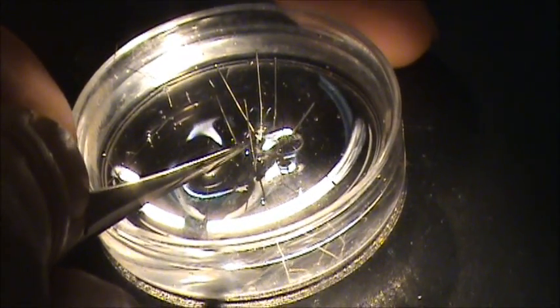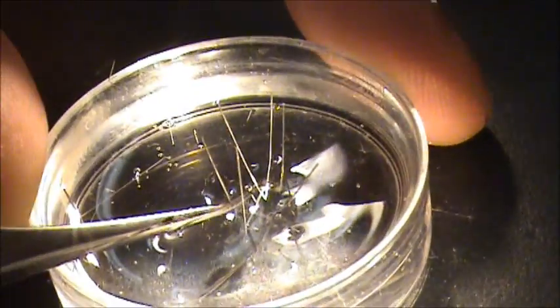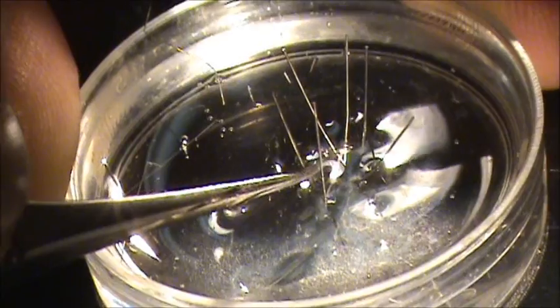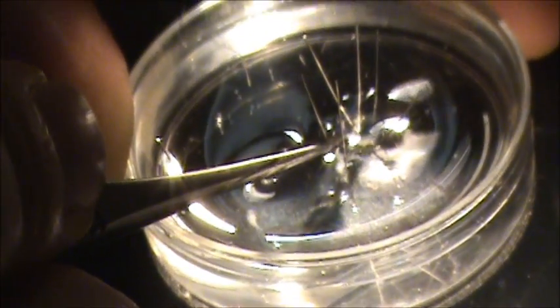Right now we can see the big Retzius cells and those cells in the medial part. So I'm going to come in and make my first little nick where the connective comes into the ganglion. You can see that the tissue sags off a little bit right there and it's a good place to begin your cut. Here's where you can see at higher magnification where the connective is coming up into the ganglion. So we would make a small little nick right here and then just as we did with the black stocking, take the bottom half of the scissors and sort of glide them around the ganglion and pull up this tissue. Just cut it right across.